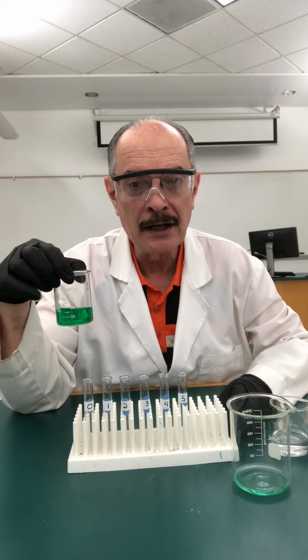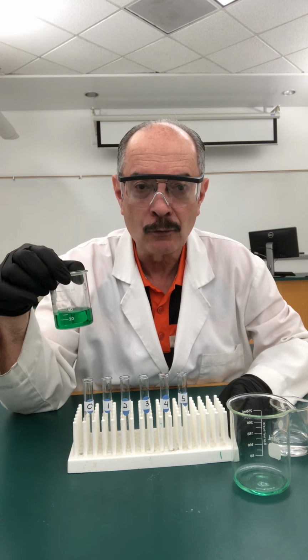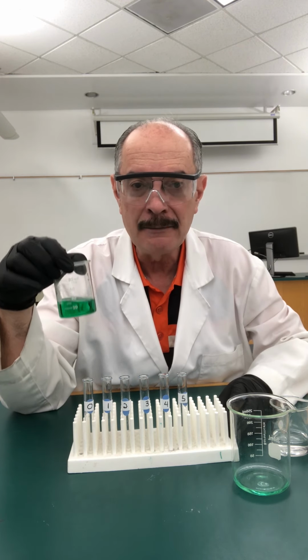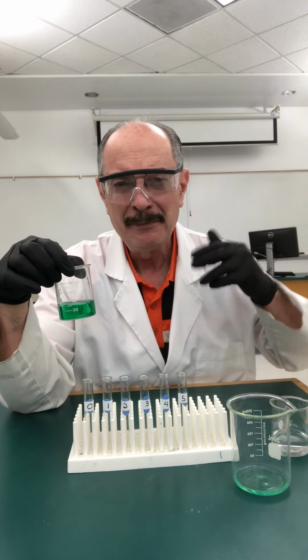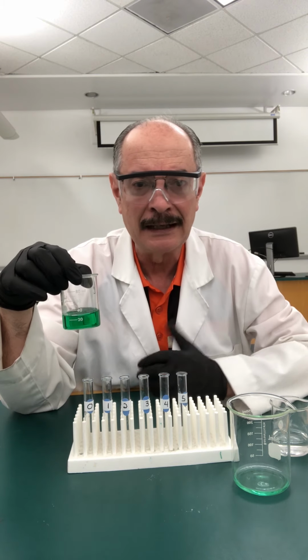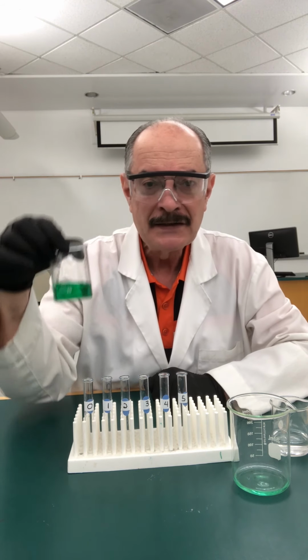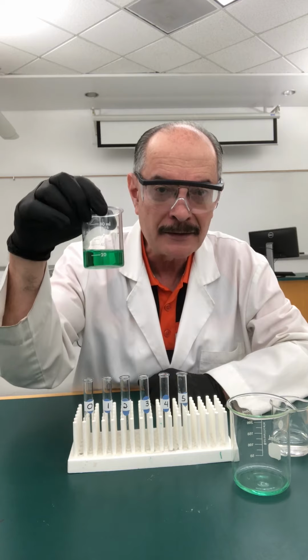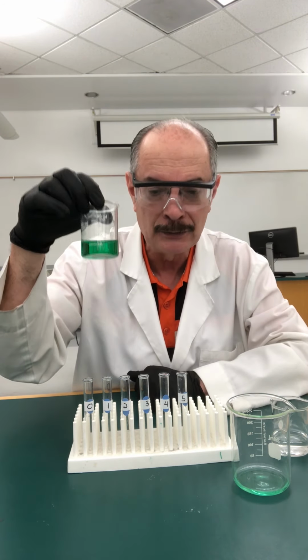So this is where it goes. Now, of course, we could start with the solid viridis and calculate how many milligrams and how many milliliters and what have you to make these molarities, but you can imagine the time cost in that and also the abundant use of glassware that we then had to clean or dispose of. So since we already have a spectrum for this specific solution, it is better to start from here and make our dilutions directly from this solution.